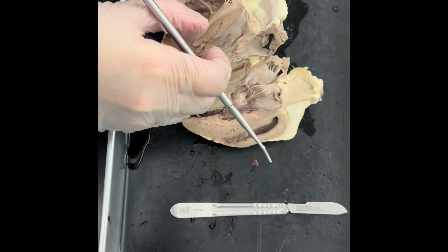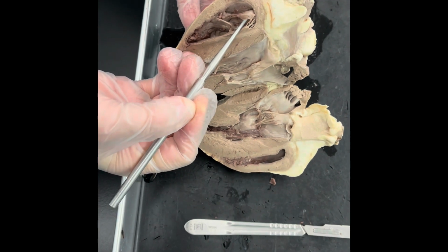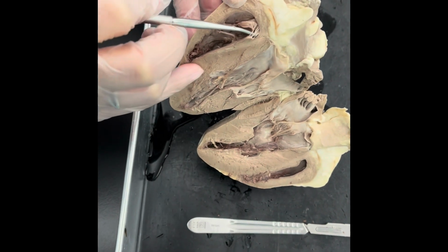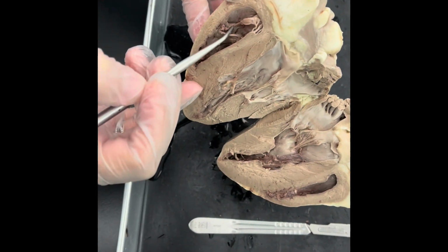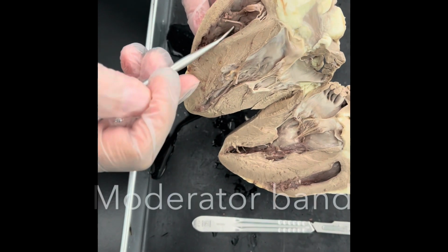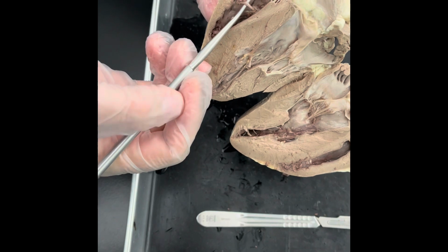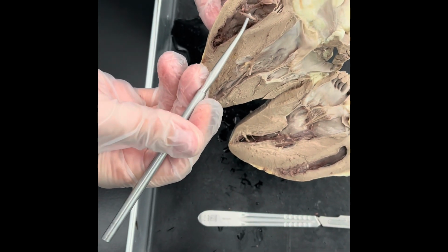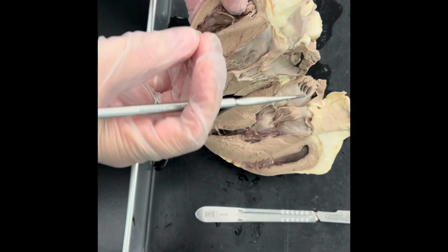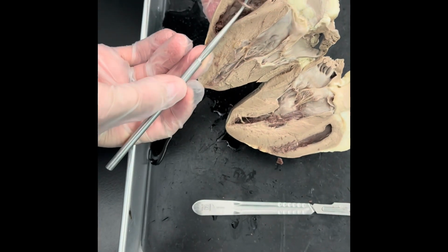In the right ventricle, you're also going to see it. And this is the tricuspid valve right there. You see some chordae tendineae right there. And then this right here is one of the papillary muscles attaching those chordae tendineae. Now this thing right here that's sticking out, it's called the moderator band. The moderator band is only located in the right ventricle, and it helps the ventricle not overextend when it relaxes and then contracts. So that's called a moderator band.